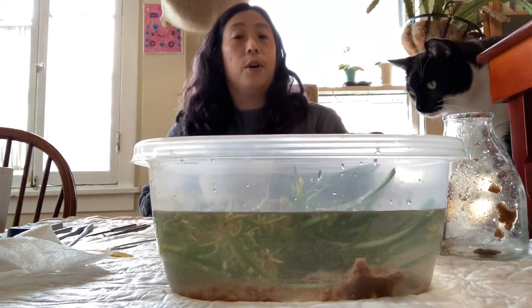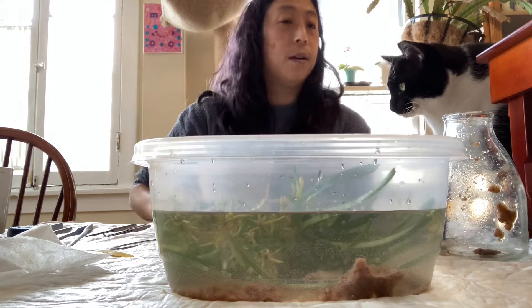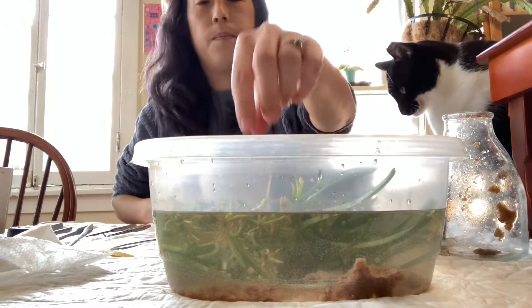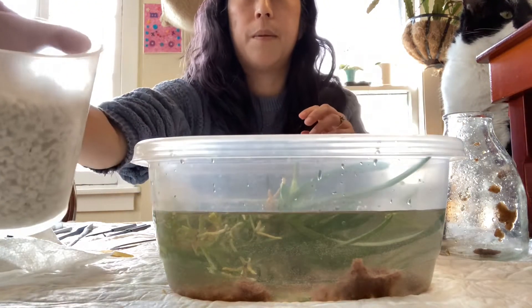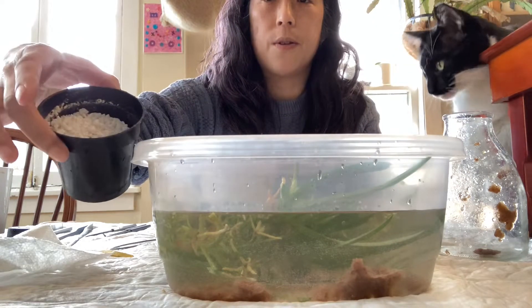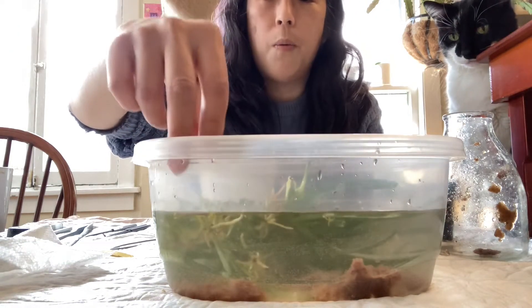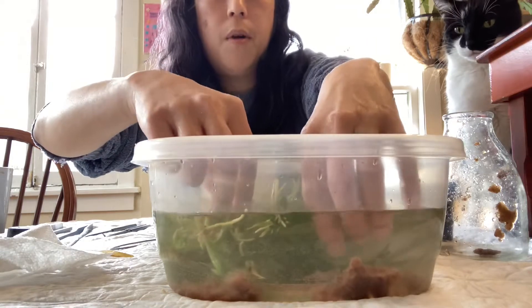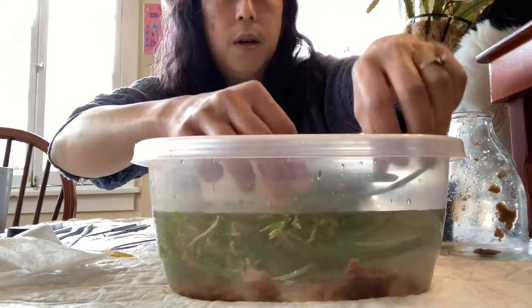Pinto and I just had a very long combat over how many times he was going to knock over the phone. Pinto won. We took a break so that he would stop knocking over the phone. So behind here, what you can't see is I have some containers with perlite, and I am going to put some of these little flask seedlings in the containers and pack them in with moss on top. I wanted to use ProMix, but this is a Vanda and they need more drainage — normally you grow Vandas without any media.